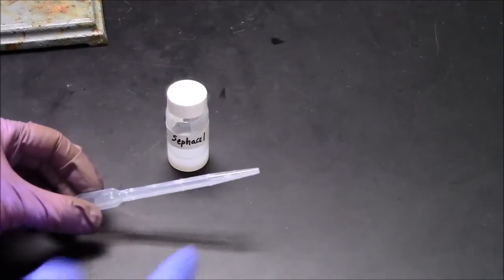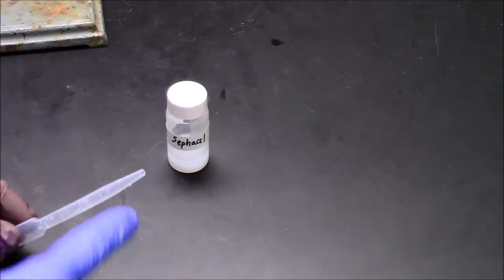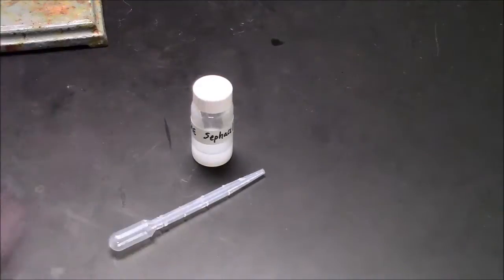This is a plastic pipette of which I've cut the end off with scissors. So that's a sawed-off pipette. The opening is now a wider diameter, which will be good for transferring this gel into the column.